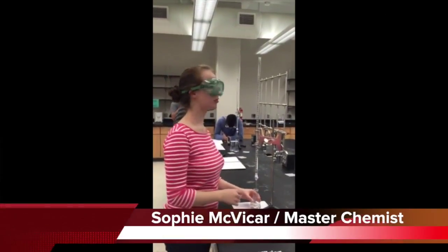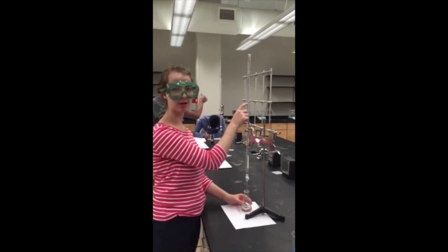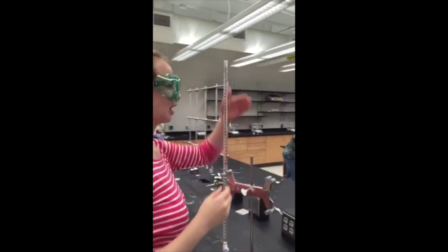First what we're going to do is determine the initial volume of the sodium hydroxide in the burette. As you can see, first of all, we have to take into account the meniscus. Once you do that, we have an initial volume of 2.87 milliliters. So we're going to begin titrating.